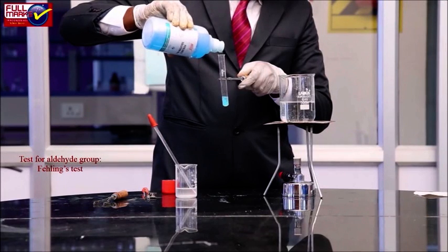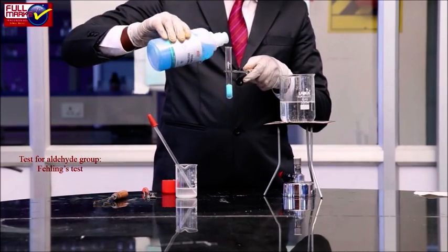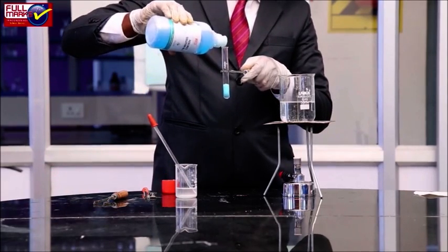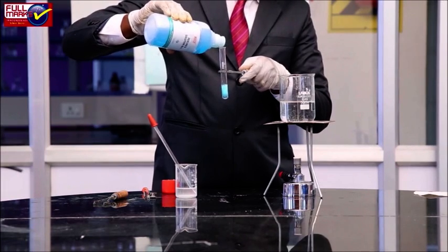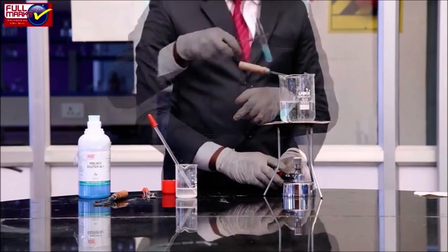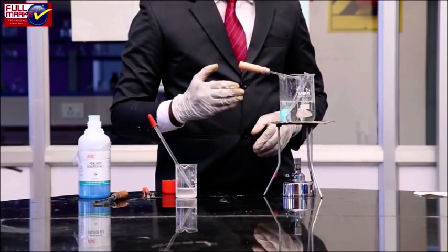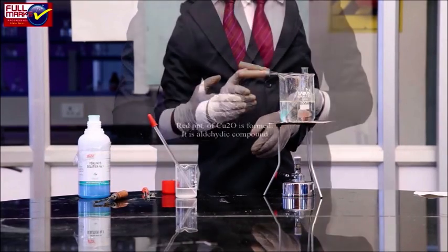Test for aldehyde group. Fehling's test. To 1 ml of organic compound solution, add 1 ml of Fehling's A and 1 ml of Fehling's B solution and heat on a water bath. If we observe a red precipitate of Cu2O is formed, it is an aldehyde compound.